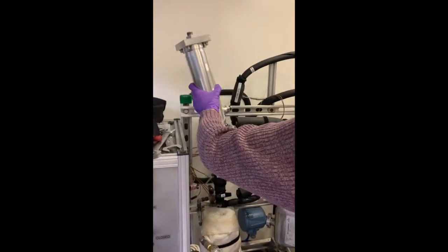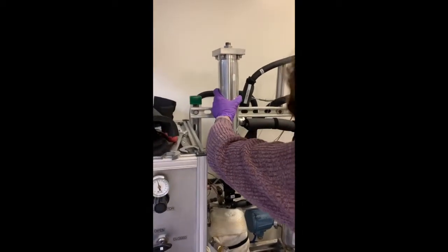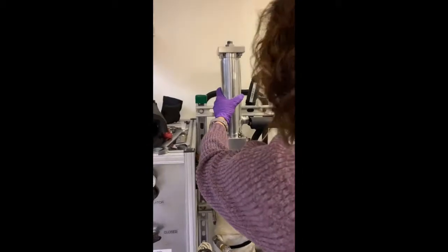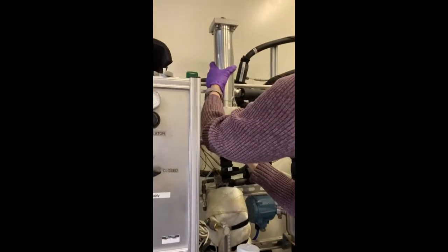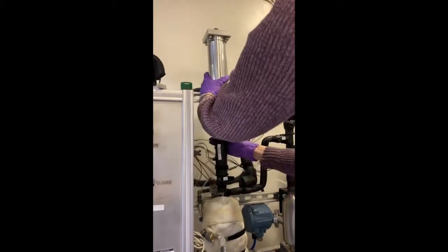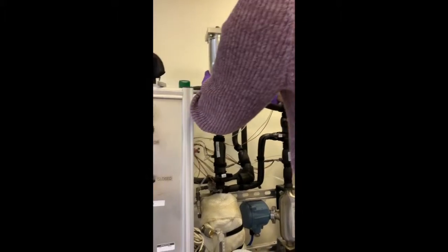Our systems can also handle APIs with diameters less than 2 microns. Today we are going to be drying an IPA water mixture. Robin is placing one of our 2 inch membranes in its steel housing into the system.